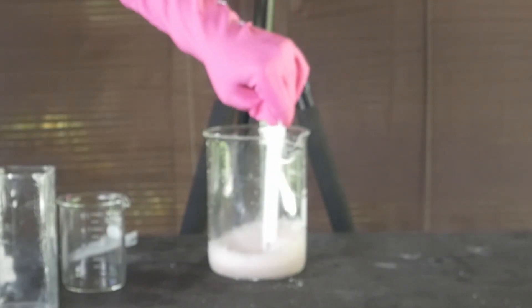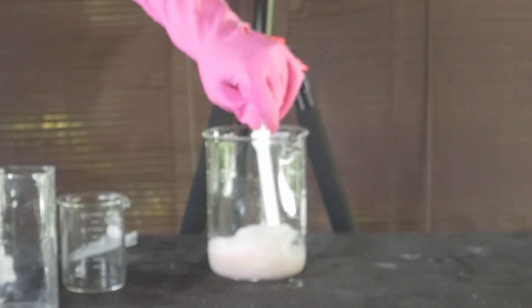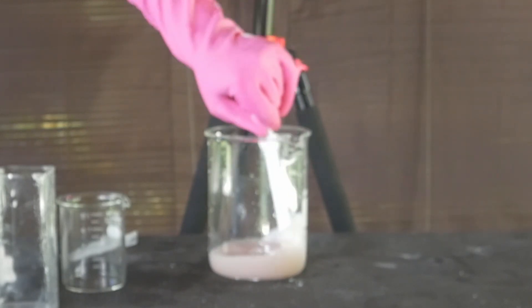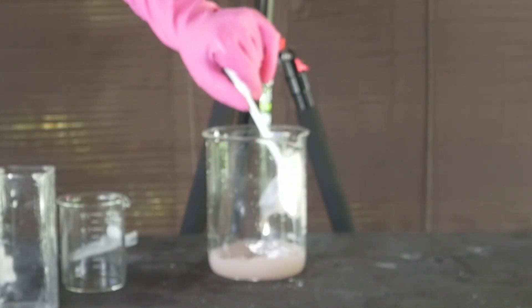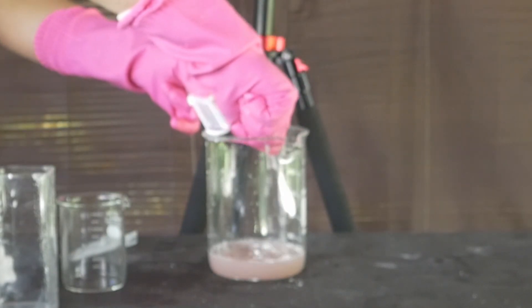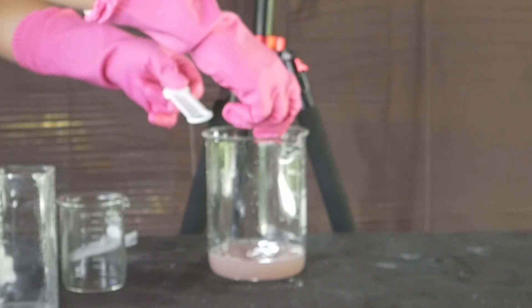If you are looking for your lungs, I'll wait. Despite our best efforts, it seems some weird impurity got into our product which I suspect is iron. Later audits will have it removed.